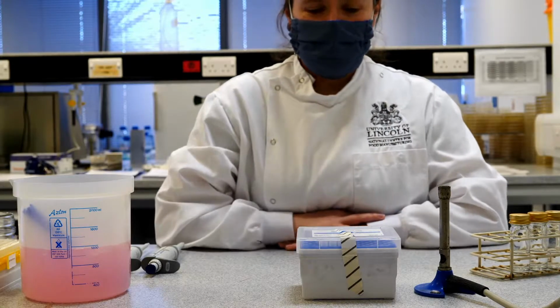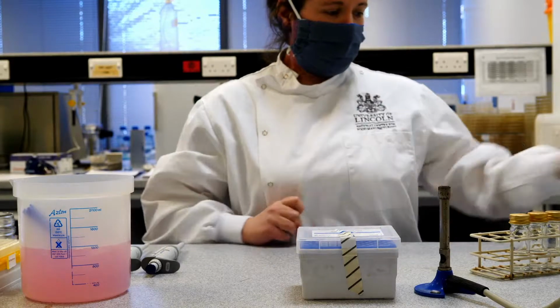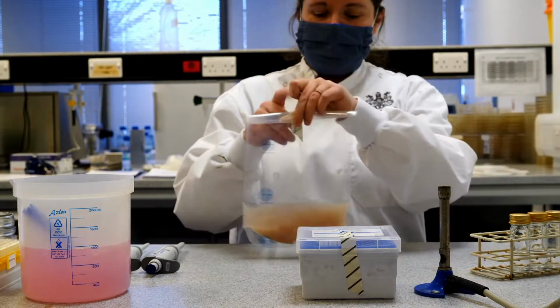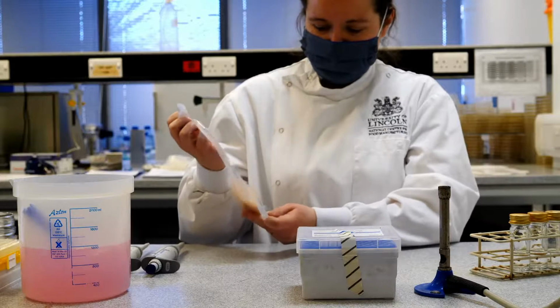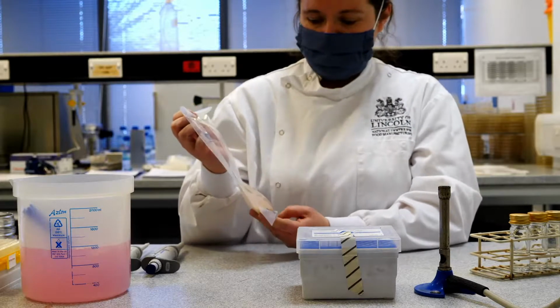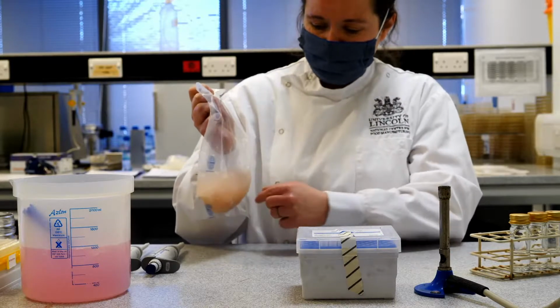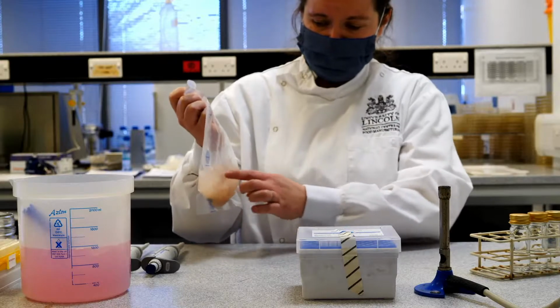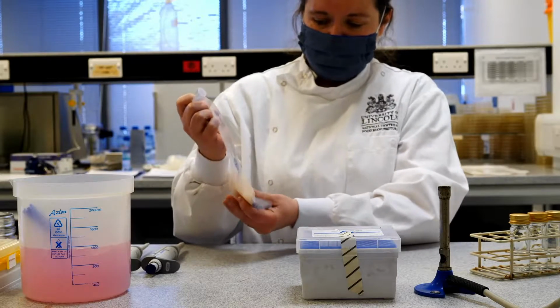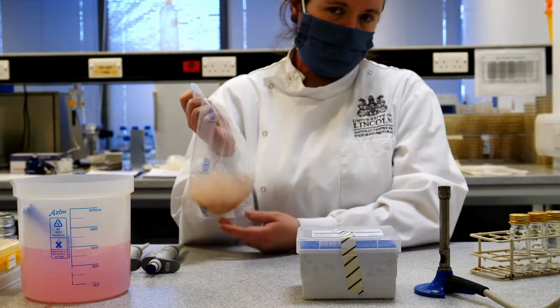As I say, what we're going to do is some very basic microbiology laboratory work, and what we're looking at today is some sausage meat that's been prepared previously. I've taken my sausage meat sample and I've stomached it to make it into a liquid solution. By doing that, I've taken all the bacteria, hopefully, that are within the sausage and mixed it up to create a suspension of those bacterial and yeast cells within this water.